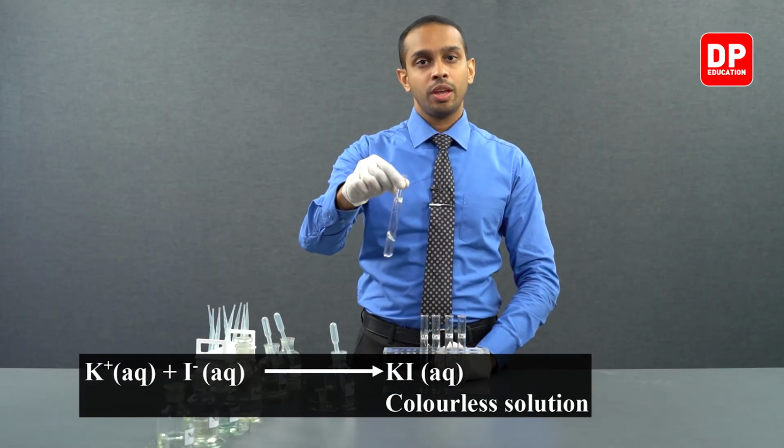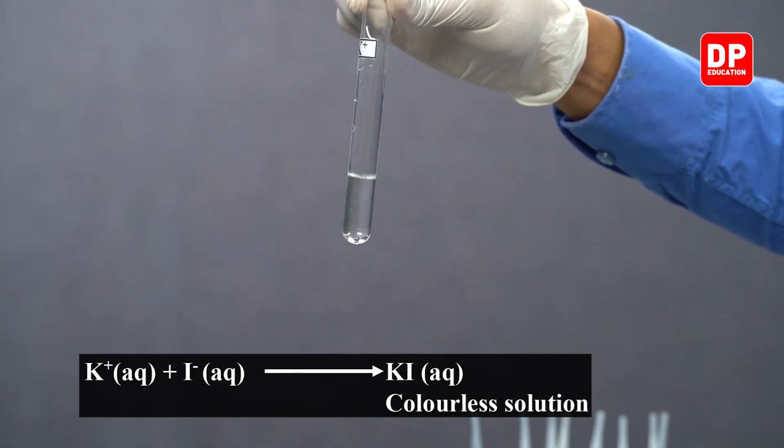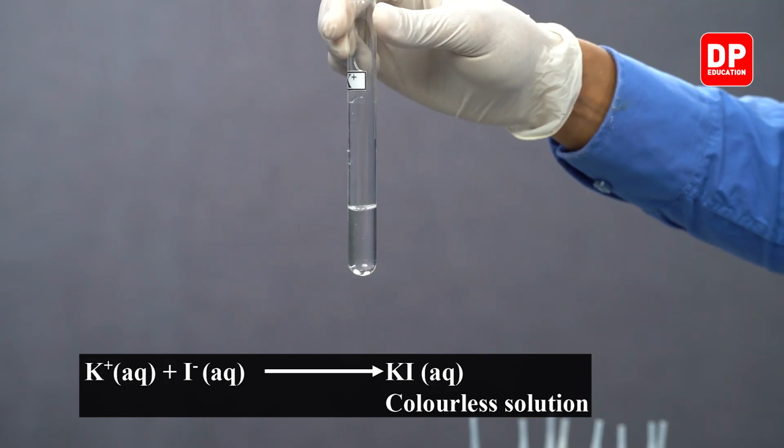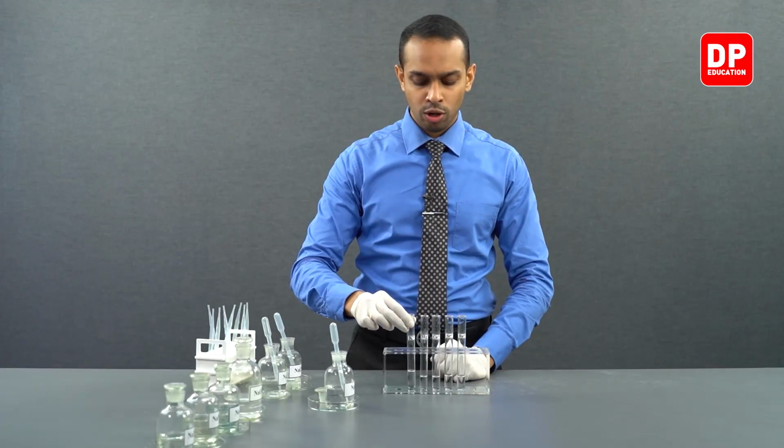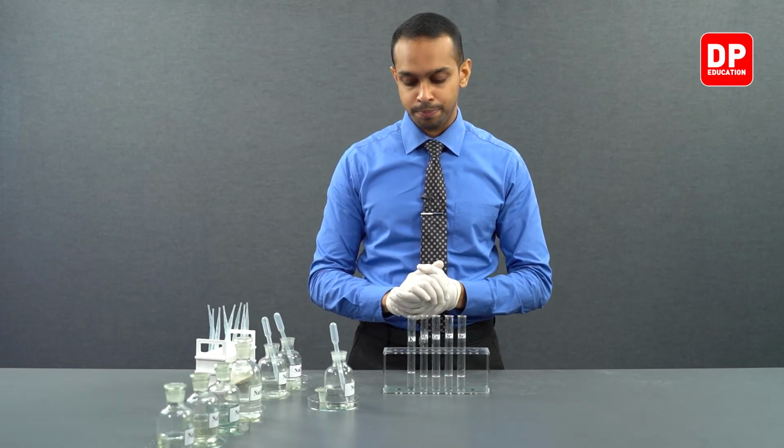As you can see, when potassium is reacted with iodide ions, it forms potassium iodide. This salt is a soluble salt in water, so therefore you will not see a precipitate.